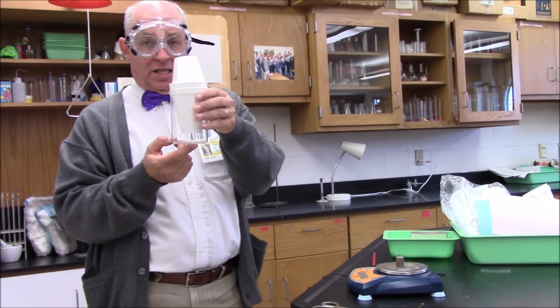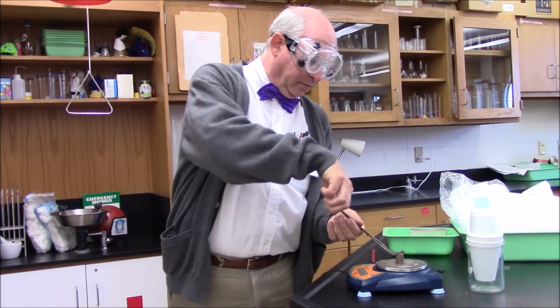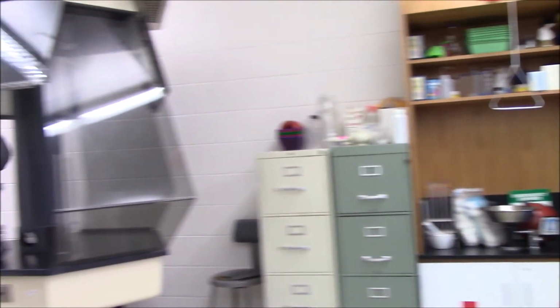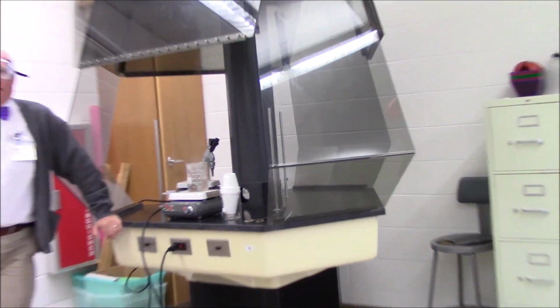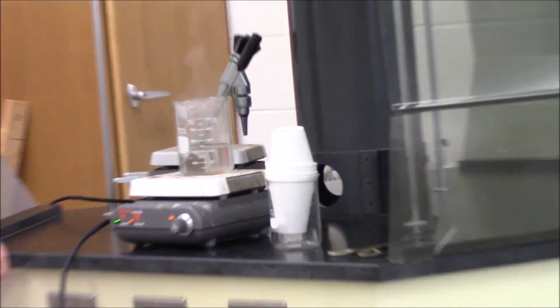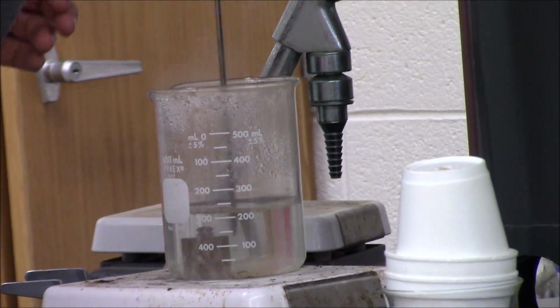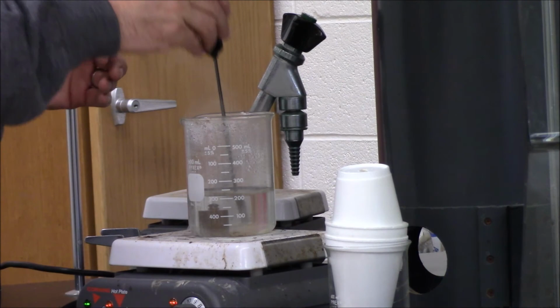The calorimeter is set up again, still using tap water at 22 degrees. The copper sample we're doing for the second trial you'll calculate is 58.02 grams. I'm going to transfer this in here and let it sit for a few minutes in the boiling water. Now it's had plenty of time to reach the same temperature as the water, which in this case is reading 99.3 degrees.